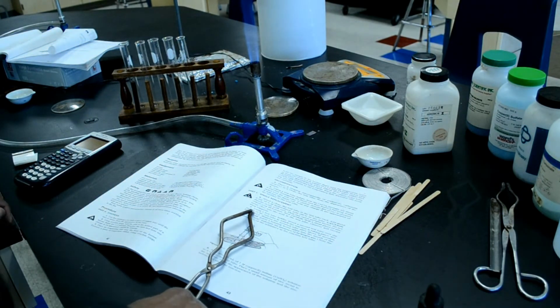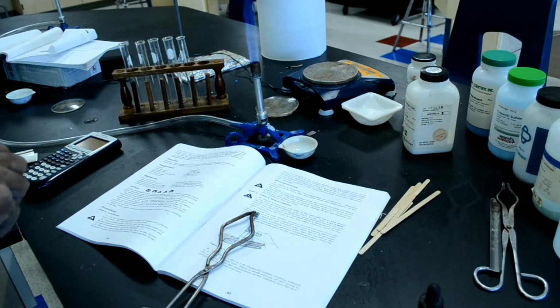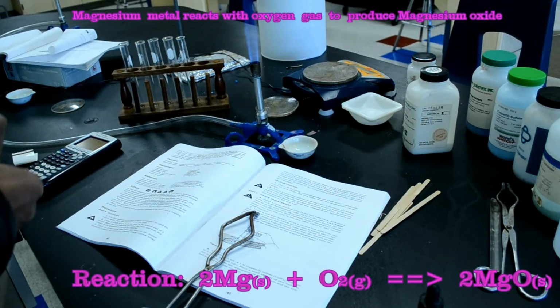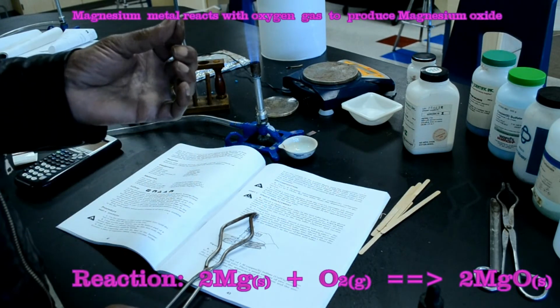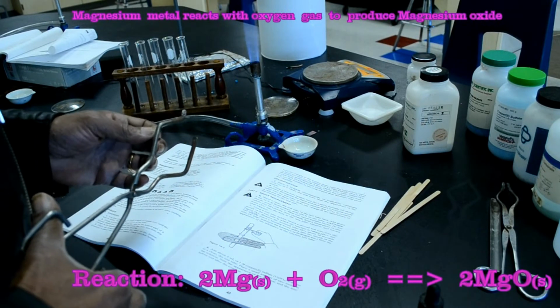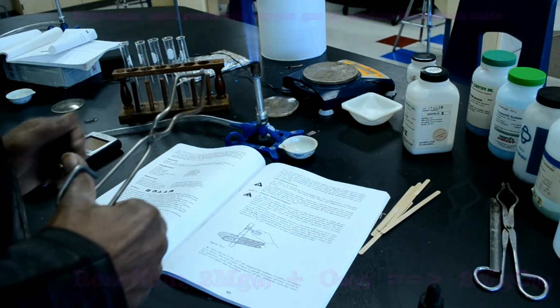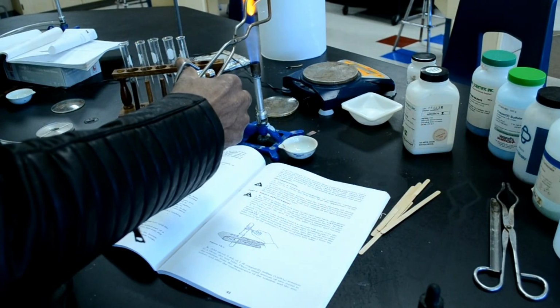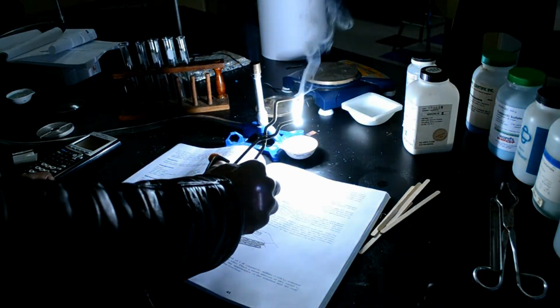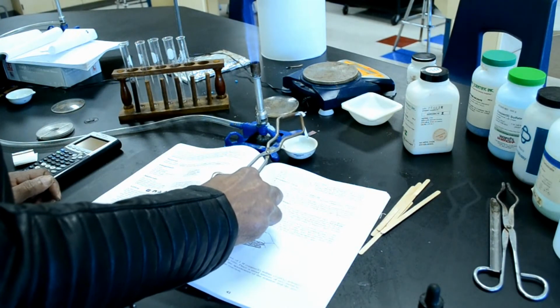Next, place a dish near the base of the burner and examine a piece of magnesium ribbon. Magnesium is a silver color. And then, using crucible tongs, hold the sample in the burner until the magnesium starts to burn. Do not look directly at the flame. Hold the burning magnesium away from you directly over the evaporating dish. When the magnesium stops burning, put the remains in the evaporating dish and examine the product.